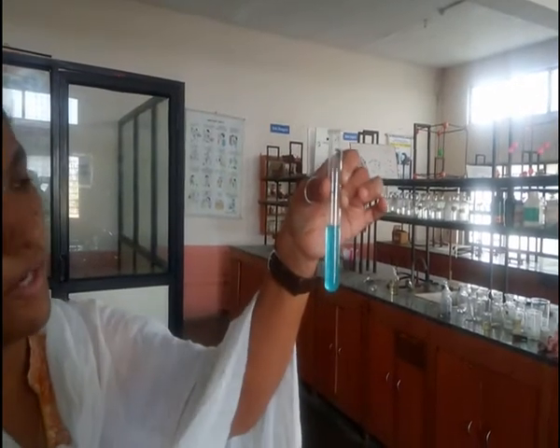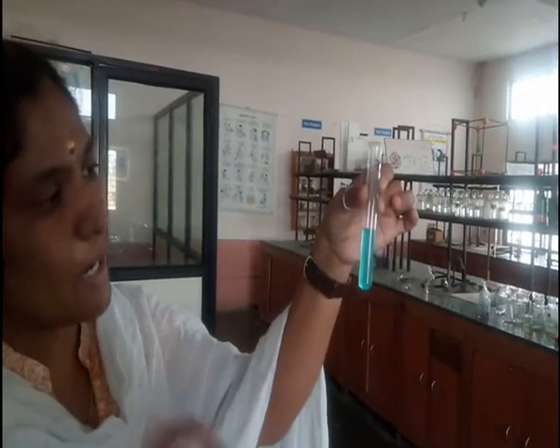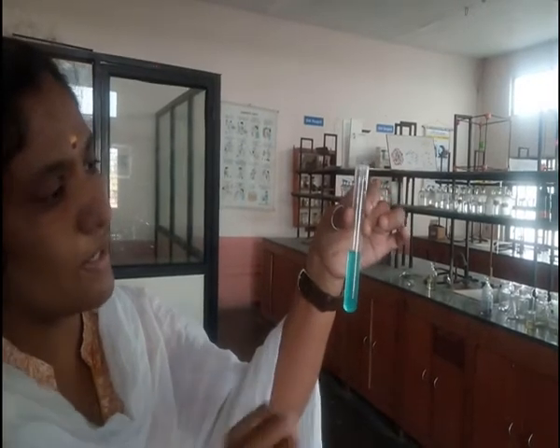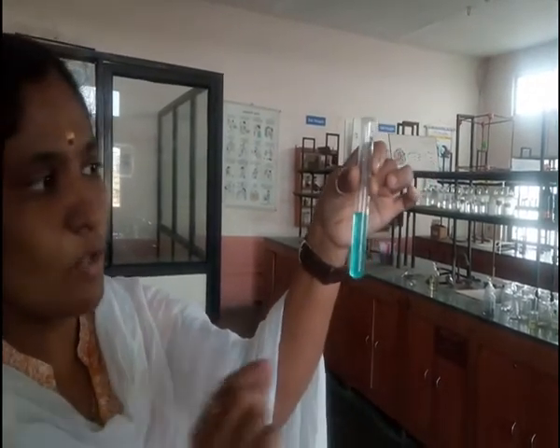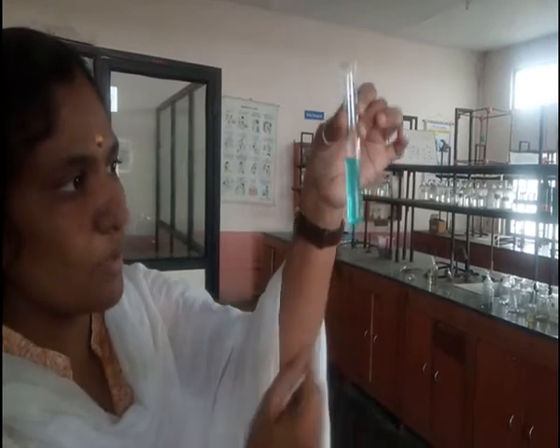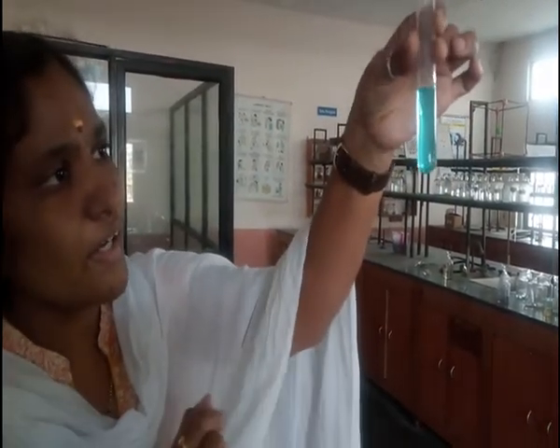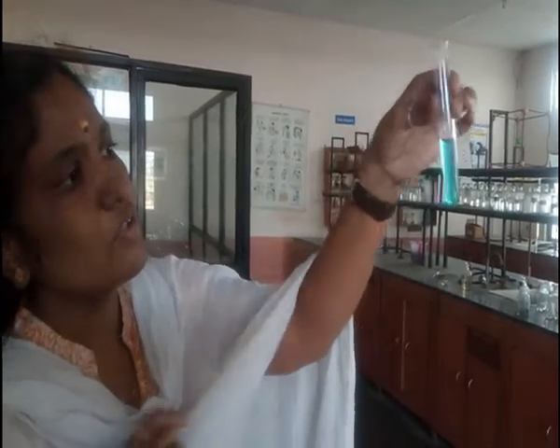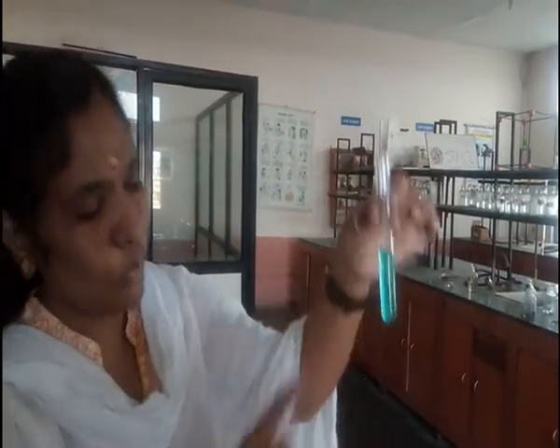A PPT has formed here. As mentioned in the presentation, PPT stands for precipitate — a solid insoluble residue. Observe it carefully: it shows that you have some solid particles formed.